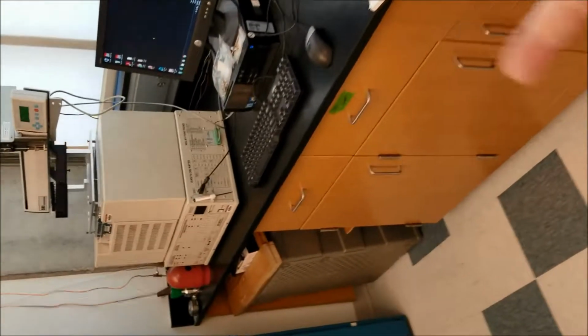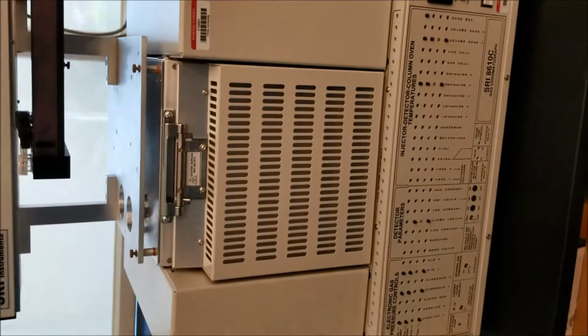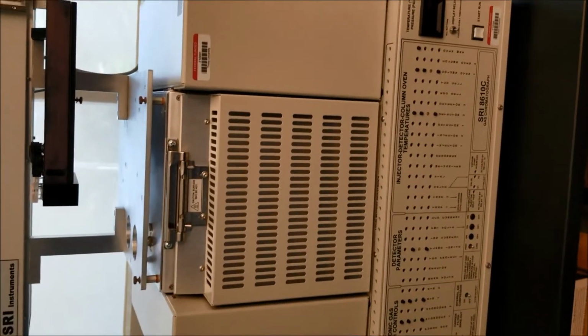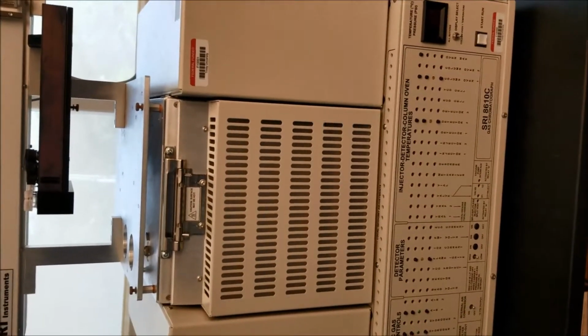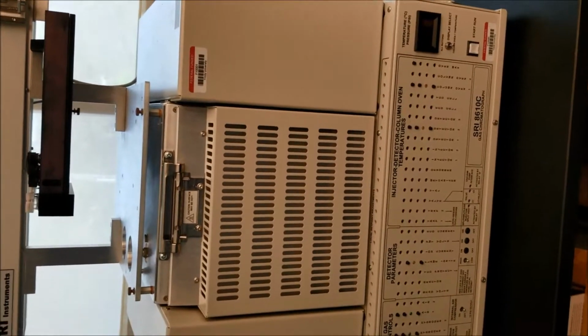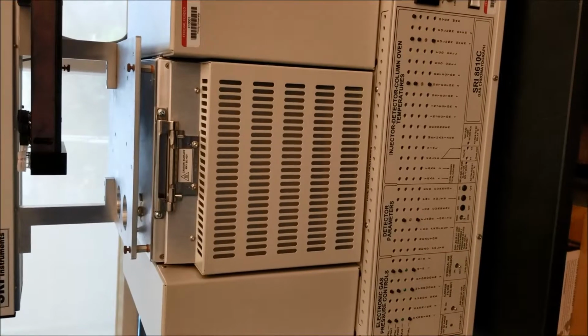The reason we waited for the temperature to go down is that we didn't want an hour or 2 hours of a very hot column, which would have presented some difficulties when the carrier gas runs out. We run the risk of deactivating the stationary phase of the column. Remember, if you're not running helium through the column, you will be destroying the stationary phase.